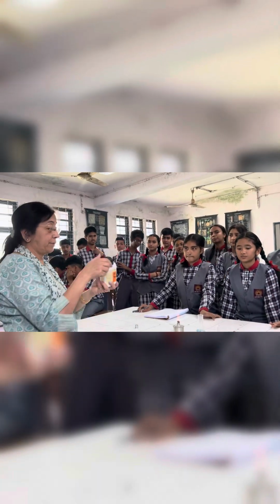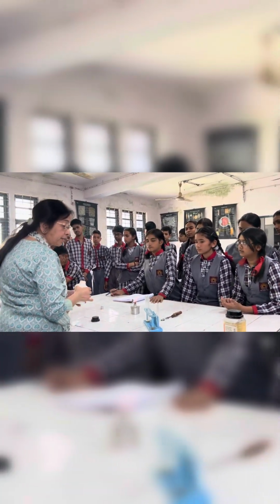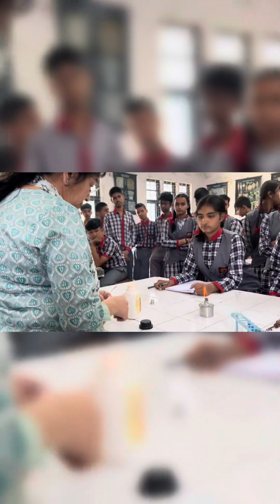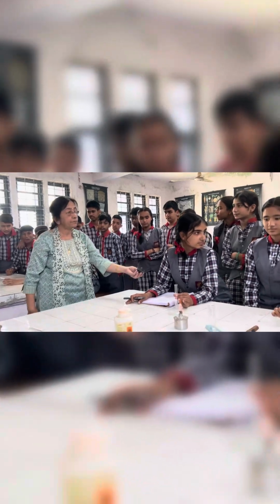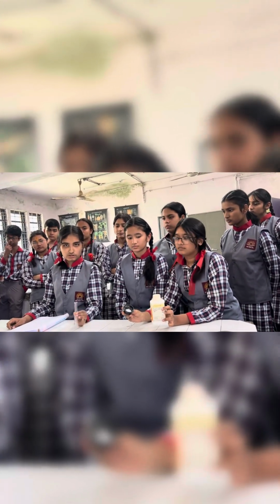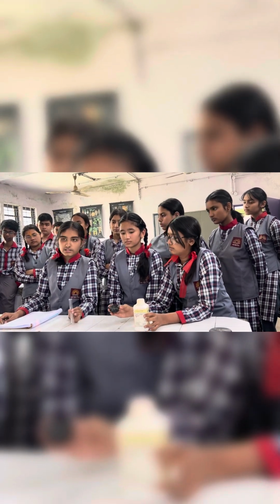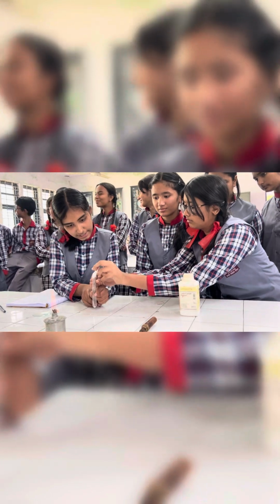Lead nitrate. Okay. Let us open the lead nitrate and see what color it is. Where is your test tube? Is this it? Yes please. Today we are going to do a decomposition reaction. We have lead nitrate and a test tube. We will add a little lead nitrate to the test tube and burn it. As you can see, the color of the lead nitrate is white.